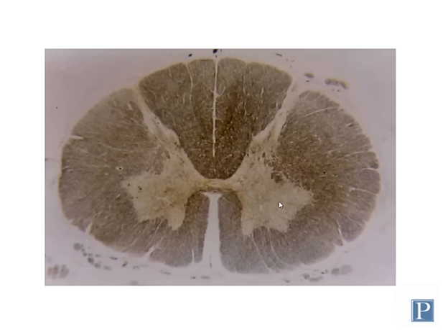So when it's stained, it can change the appearance dramatically. So again, this dark or black colored tissue is all white matter, and the gray matter appears relatively white in this picture.